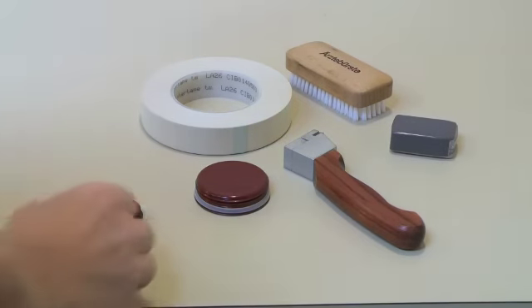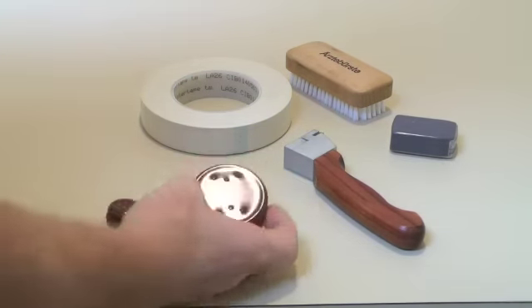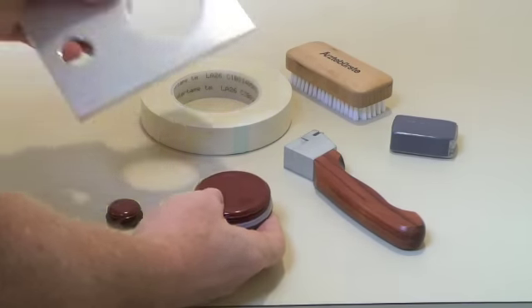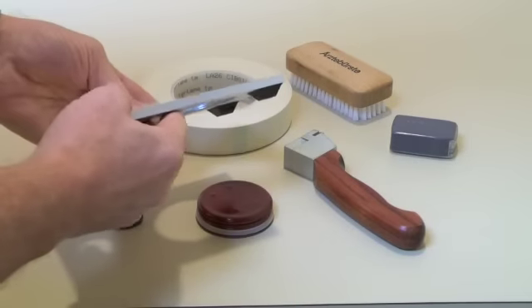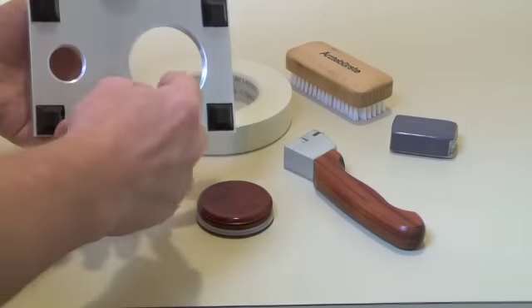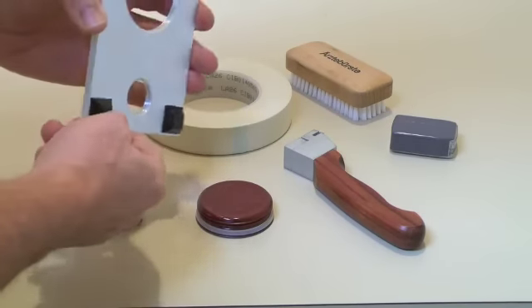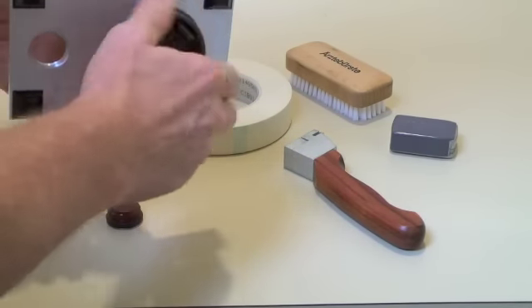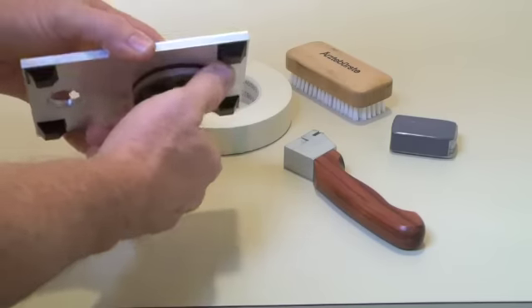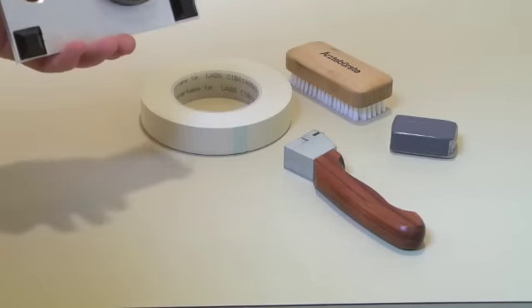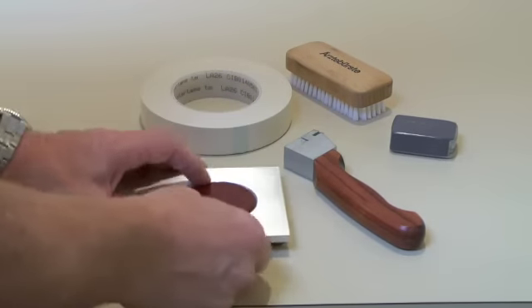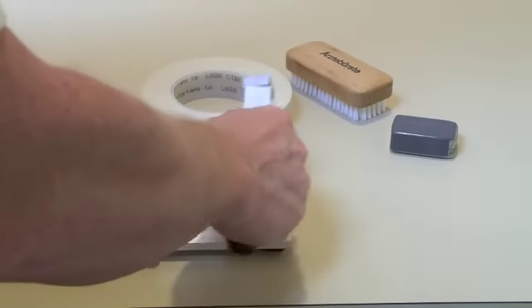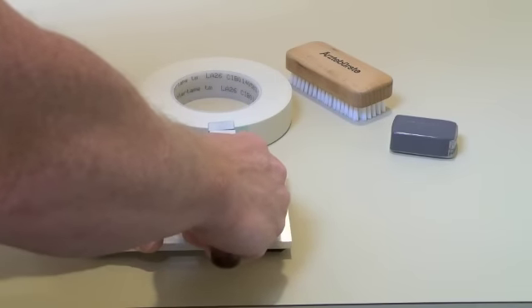In order to perform this test on these drum plugs, I've made a special plate. This is a quarter inch aluminum plate, simply with two threaded holes that match the threads on the drum plug. So now I can thread the plugs into the plate. We will only work with the large one at this point.